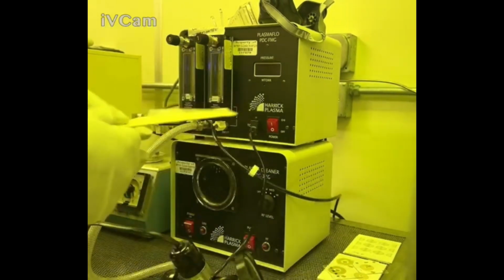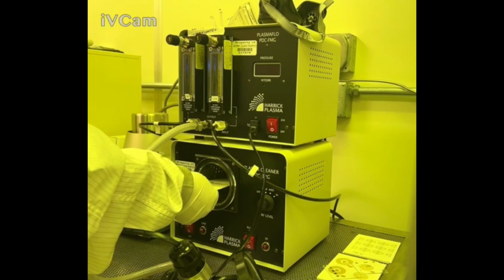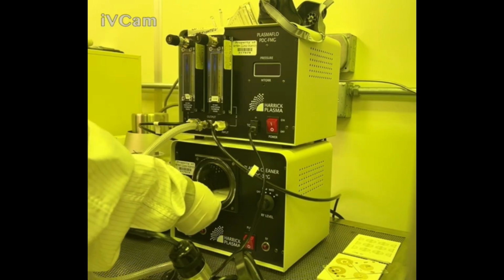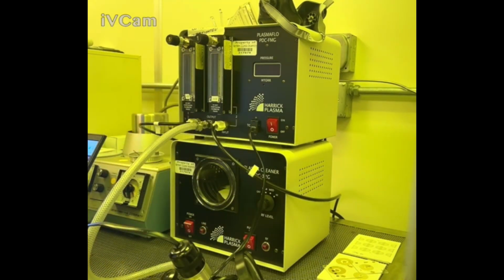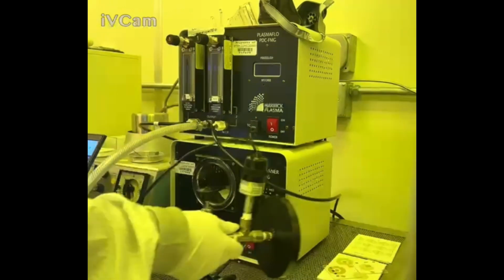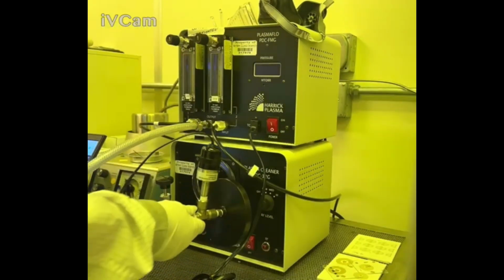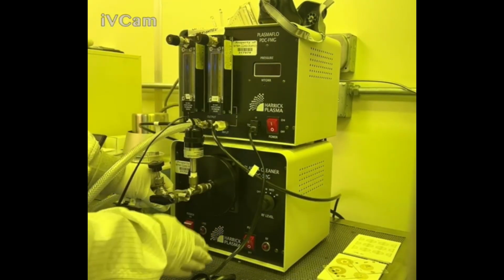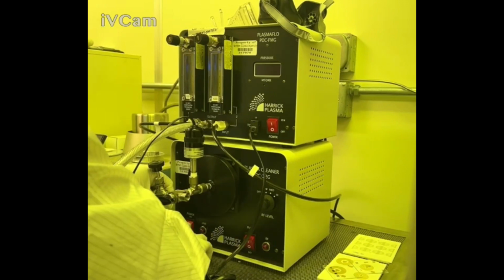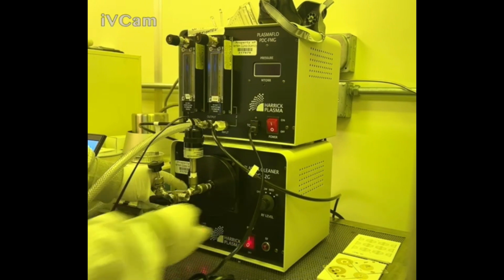white edge here. The reason for that is because the chamber is pretty skinny. You might be able to get away with something that's the same size as the middle of the chamber, but it gets a little more difficult the larger it is. You're going to take the lid, have the tubing go on your left side, align it with the opening of the pump chamber. You're going to power on the plasma cleaner, and then you're going to turn the pump on.